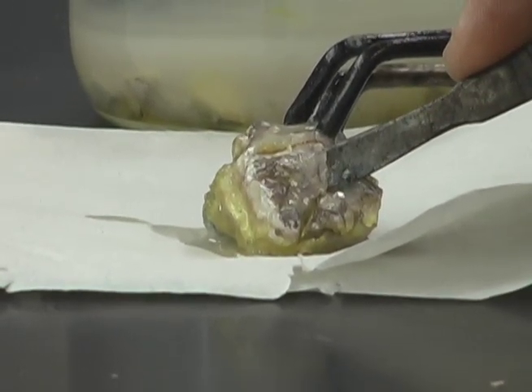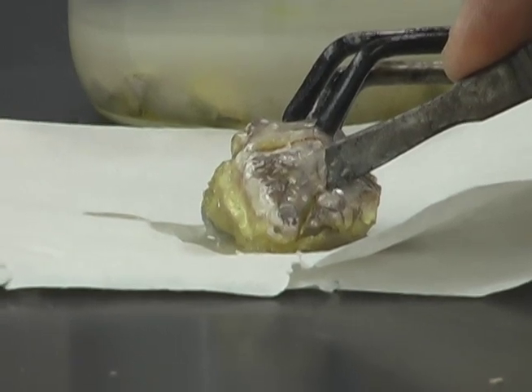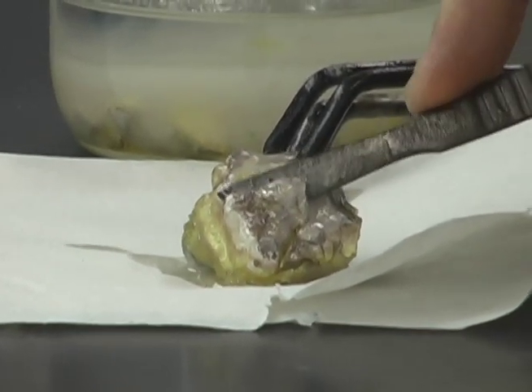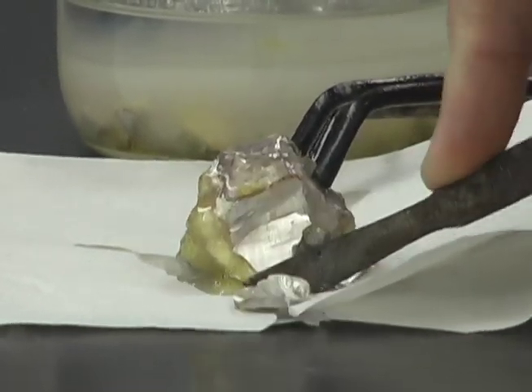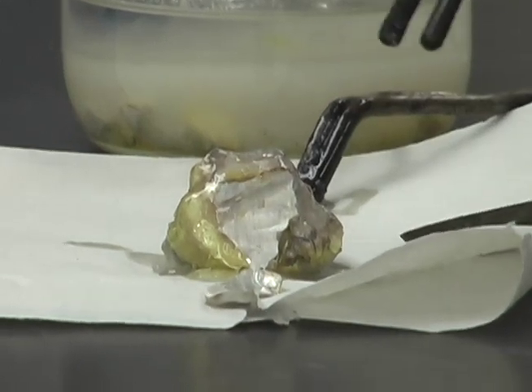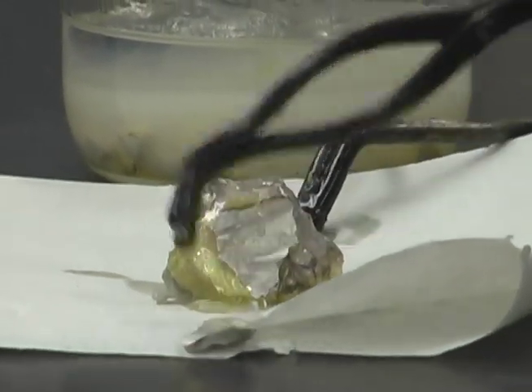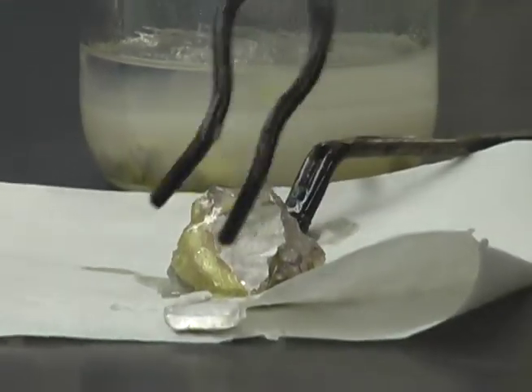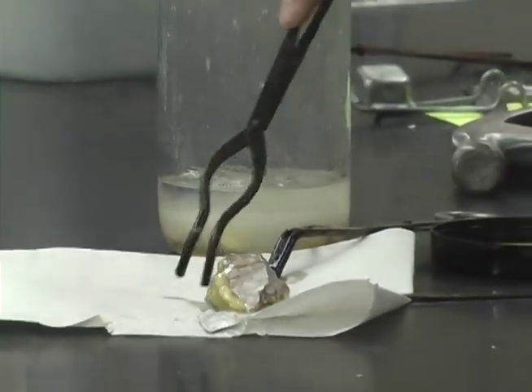How big a piece should we use? A big one. Huge. Pulling off that little piece, we need to use the rest. Yeah. Right there, that whole other side. Man, use the whole big part. You see, it's a silvery... This is sodium.